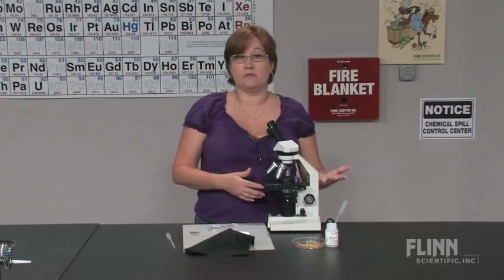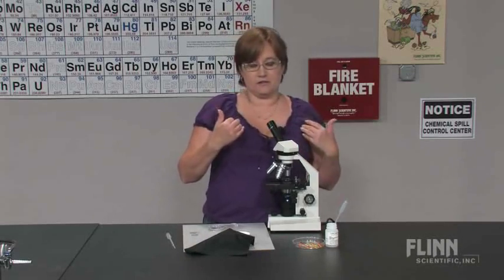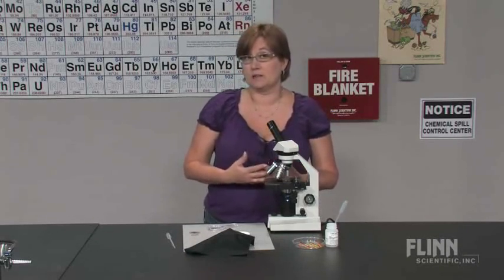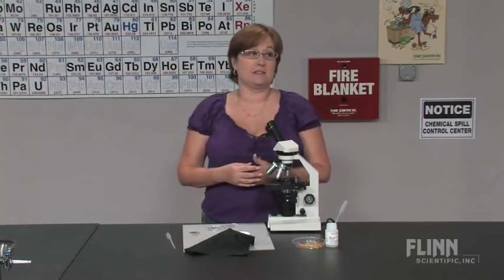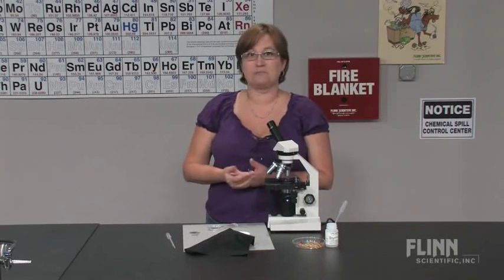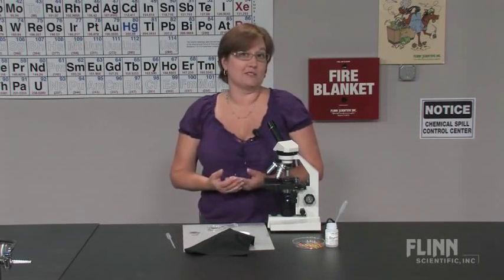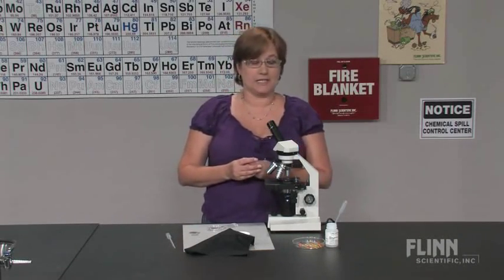What students will find, and they'll forget, they'll look at them without slowing them down. You can play a game with them and let them try and follow the paramecium through the culture. It is three dimensions and students will quickly become frustrated.